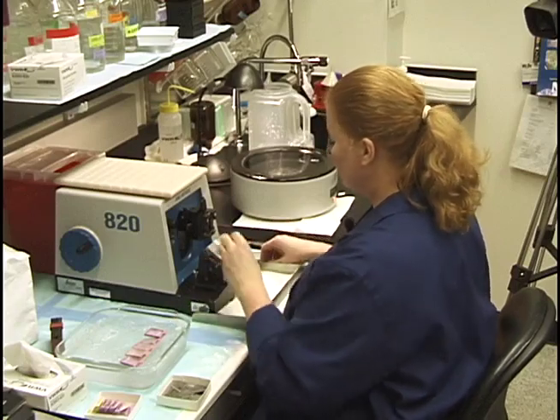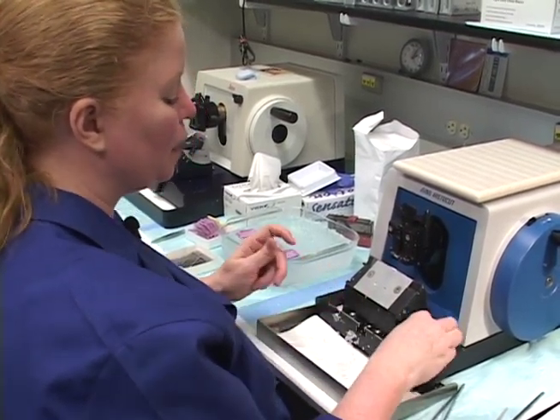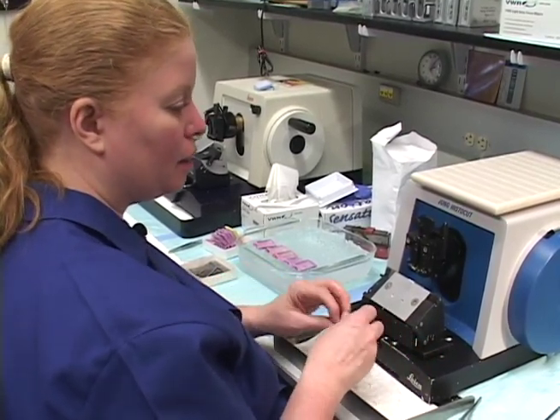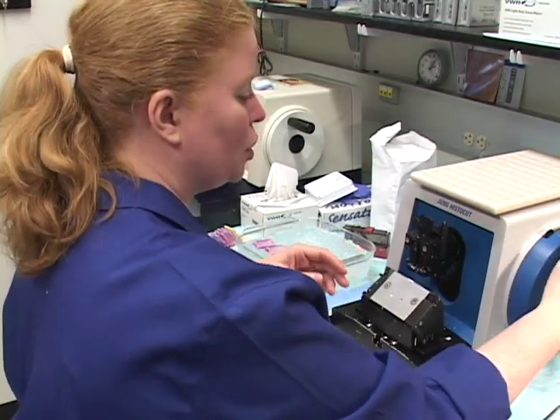I have these blocks soaking in crushed ice and water. If the tissue is particularly dry — for example, spleen, bloody tissue, hemorrhagic ovary, or pituitary gland, which tends to be very dry — there are a couple of tricks you can do.